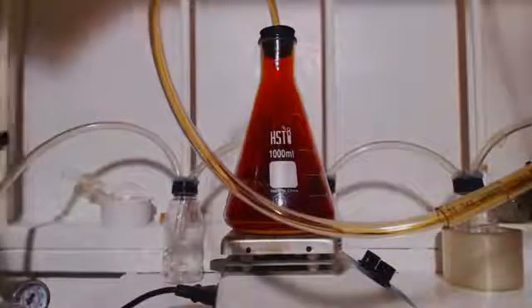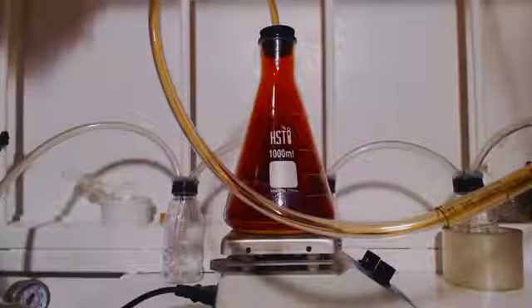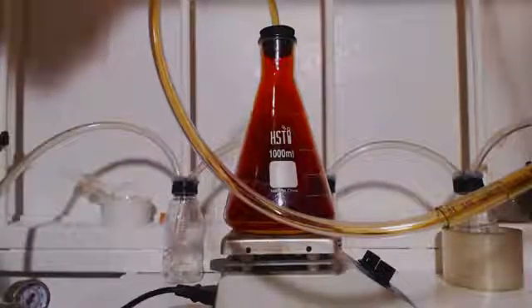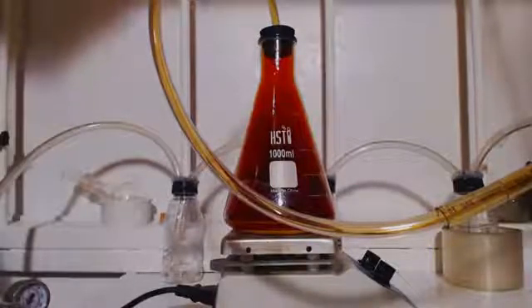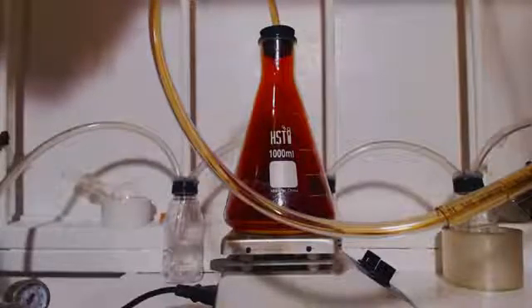All right, so when I added that, it was from the freezer, so it was cold. The water was just from the tap, tap water. You can see when I added them together, they heated up.